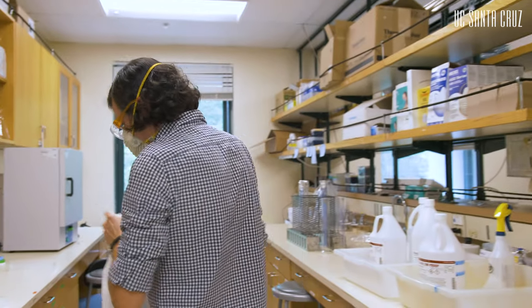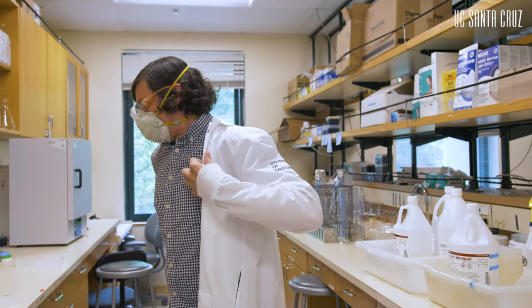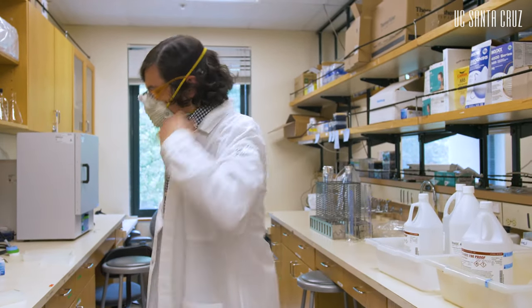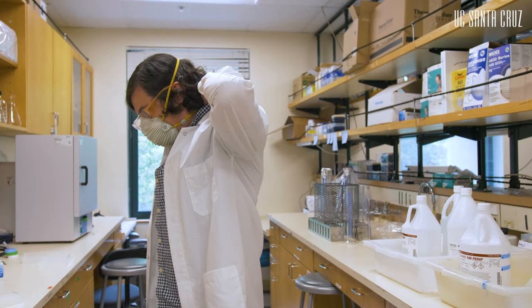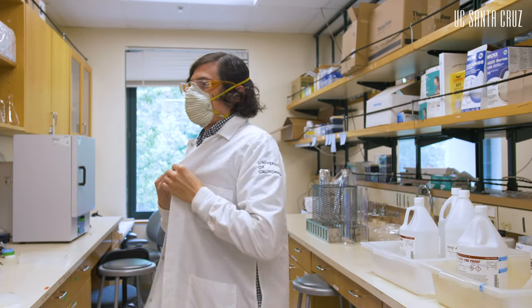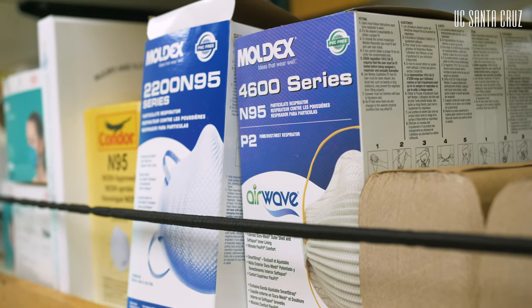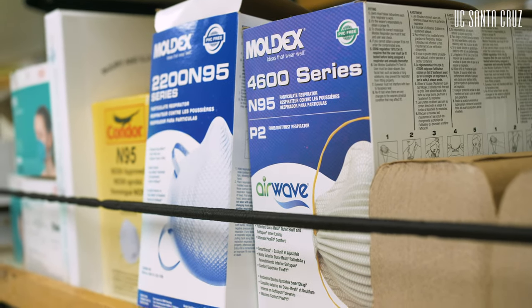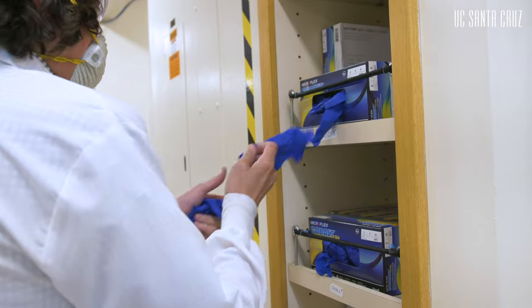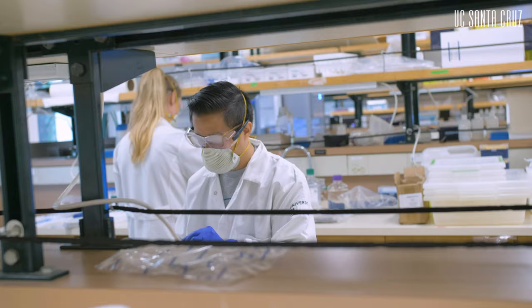Before entering the lab, all personnel must wear personal protective equipment, otherwise known as PPE, and must be trained on biosafety and protected health information. The PPE required includes an N95 mask, lab coat, goggles, and gloves. This is to protect the lab staff and to ensure that there is no contamination in the lab.